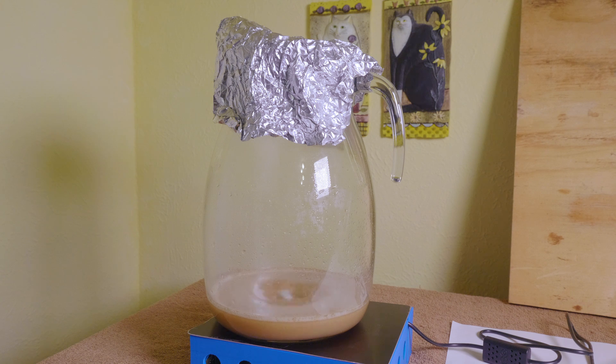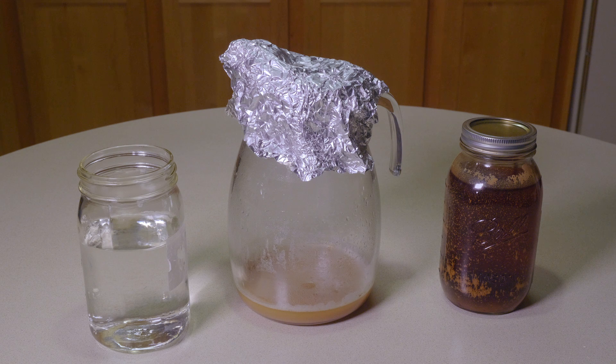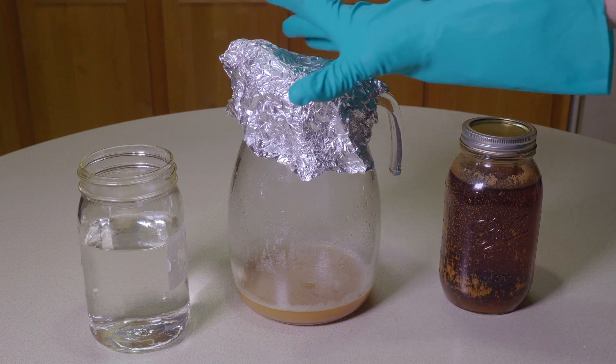15 hours later, you can see we have a lot more yeast swirling around. There it is, close up. I think we're ready to move to the next stage. This is where we're going to step it up to about two liters.